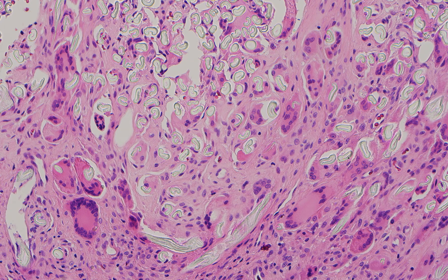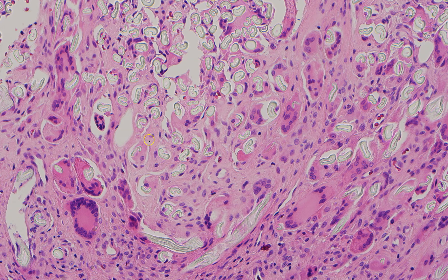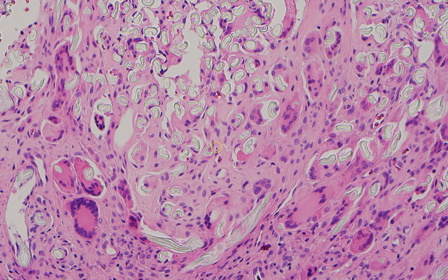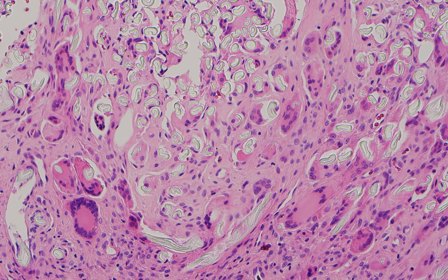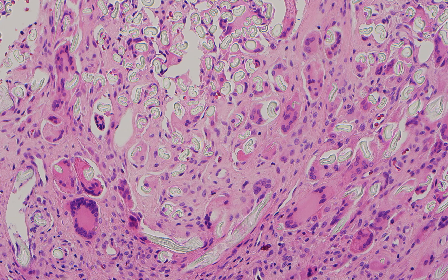Here's a view of that same area where I flip the condenser again, just to show that three-dimensional refractile nature. This is what we call refractile — if it looks like it has three dimensions and kind of stands out from the rest of the tissue, that's refractile. Flipping the condenser can help you see that.